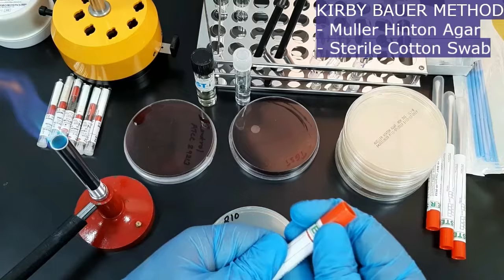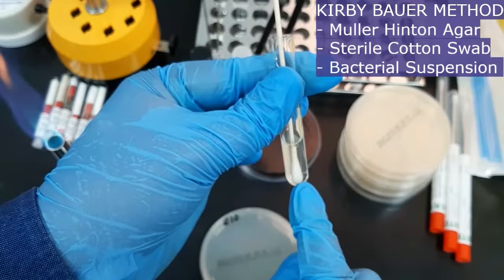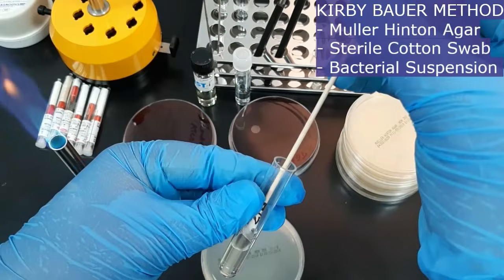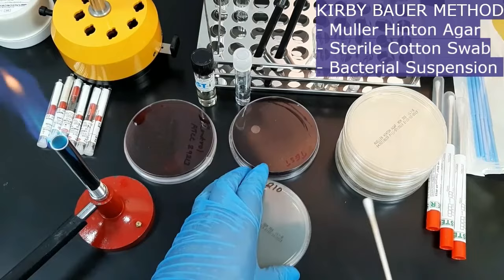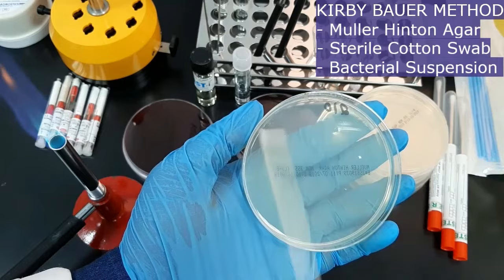Then take a sterile cotton swab and dip it into the bacterial suspension. When you take it out, remove any excess liquid by pressing the swab against the side wall of the tube. Then open the plate and inoculate it as a lawn culture, wiping the swab in a side-to-side motion gently to create a uniform layer of bacteria.